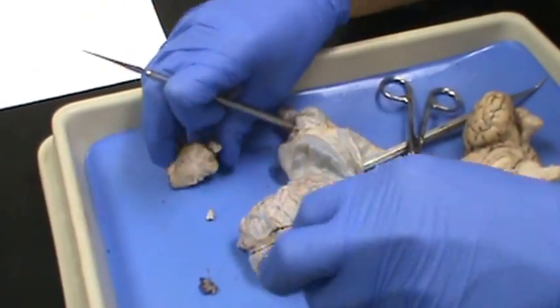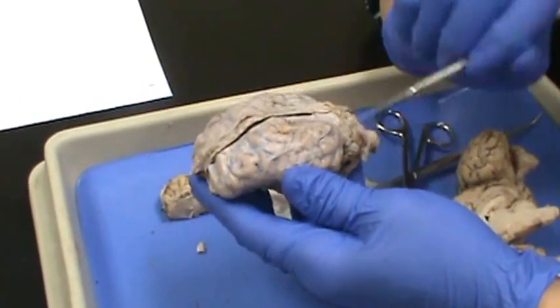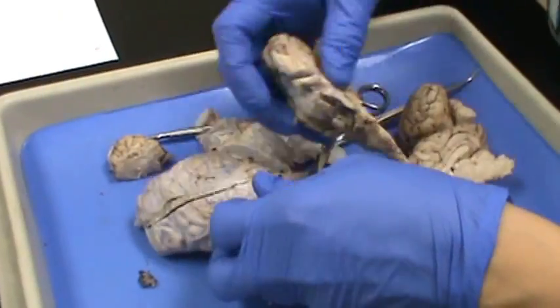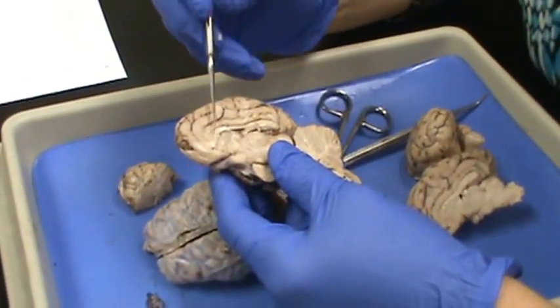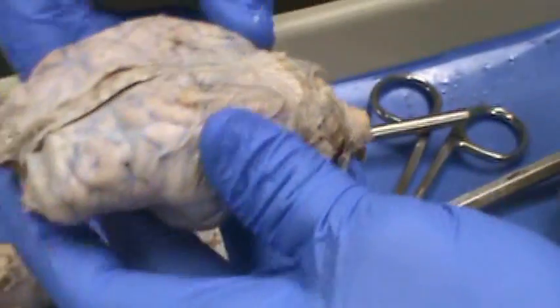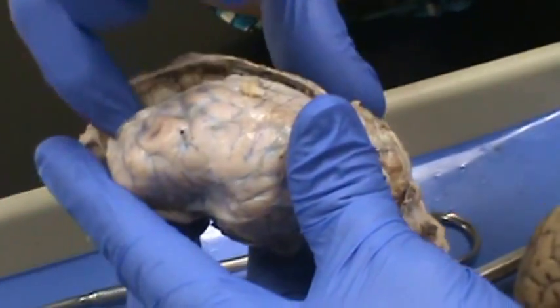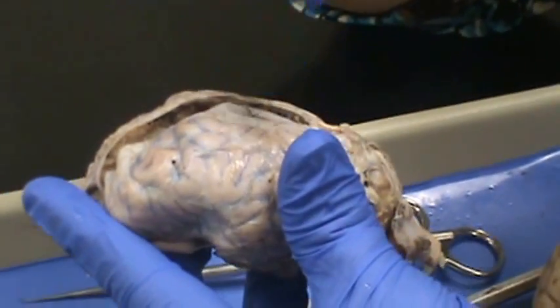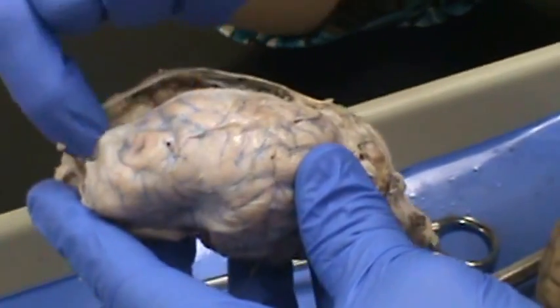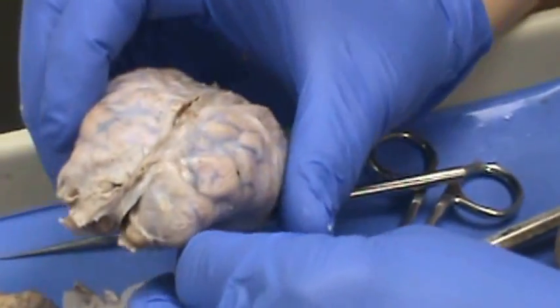The longitudinal cerebral fissure runs the length of the brain. Your brain actually does not touch the other hemisphere until you get down to the C-shaped structure called the corpus callosum. When you dissect your brain, you can run your finger along this longitudinal cerebral fissure and see that the two hemispheres do not touch each other until you get way down to the corpus callosum.